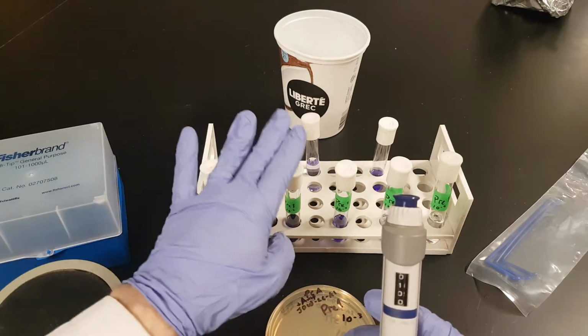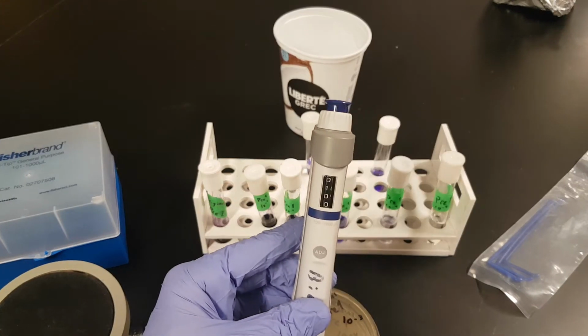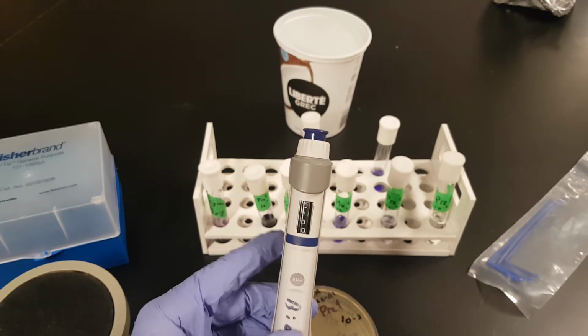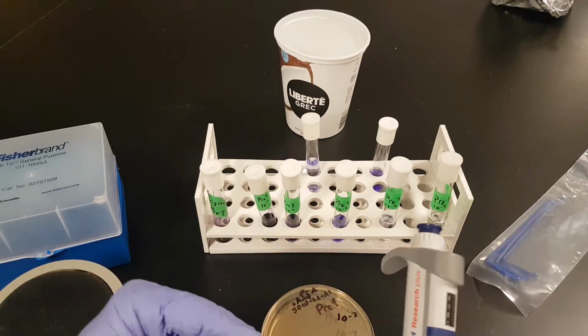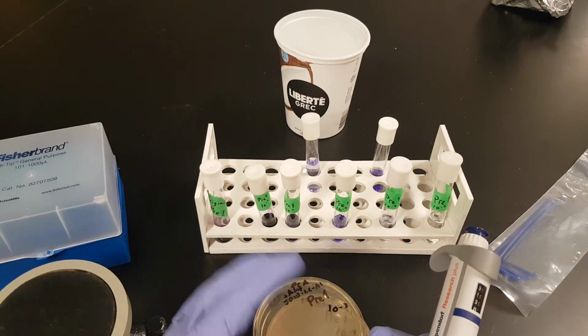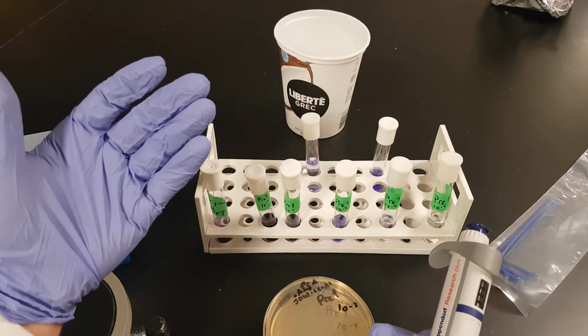Okay, so since we're looking at things per milliliter, if we are adding 1/10 of a milliliter to our plates, then we have to take that into account as well. If we were adding a milliliter, then whatever sample we use, we'd use the same number here. But we're only adding 1/10 as much, and that is why our plate numbers are 1/10 the numbers of the sample that we're putting on it.